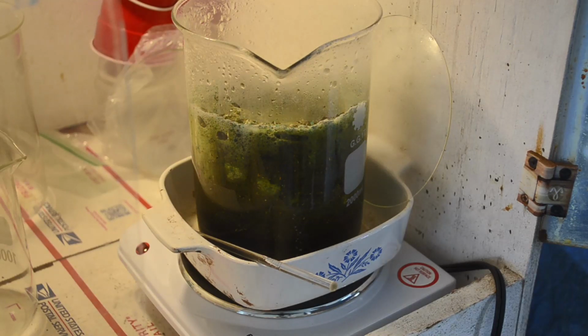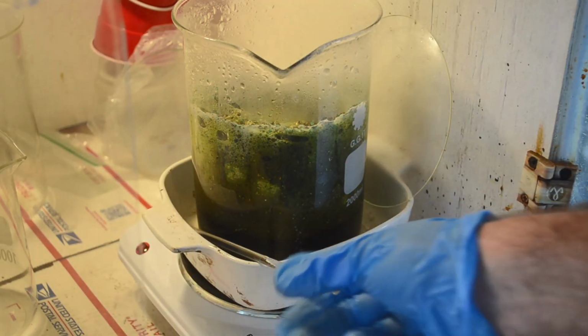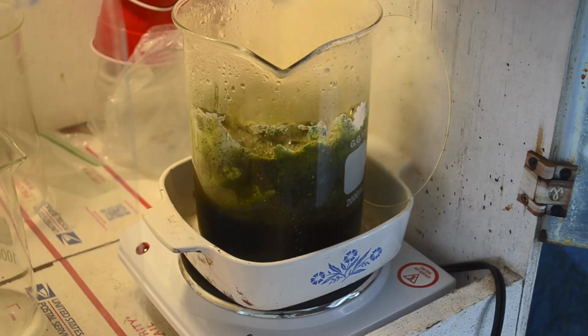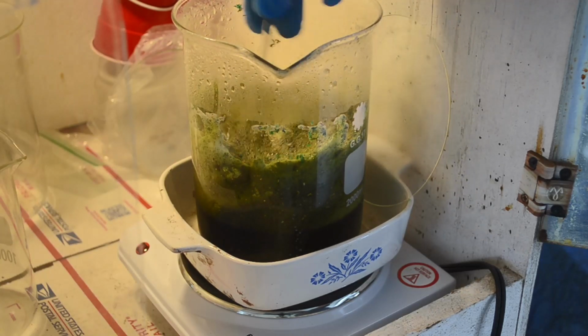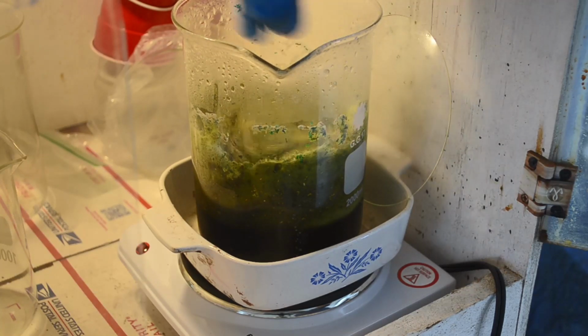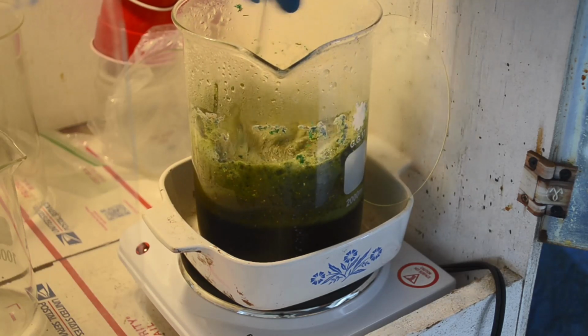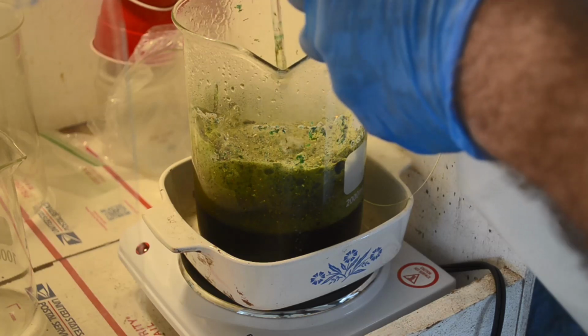And I'm going to turn the heat down, way down. We weren't crazy on the heat anyway, but I still see a lot of foils as I stir this. There's a lot of foils in there. Basically, I think we're making a pudding here.